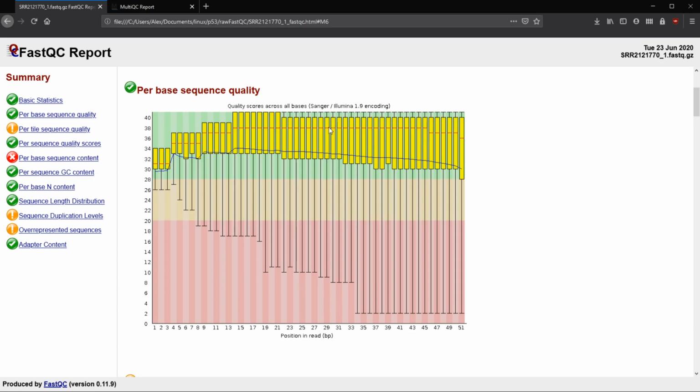The whiskers, on the top and the bottom, stretch from the 25th percentile to the 10th percentile, and from the 75th percentile to the 90th percentile. And then the blue line here, it's really hard to see, or black, if you can't tell that it's blue, that line shows the mean quality that's assigned for that base pair at this position.